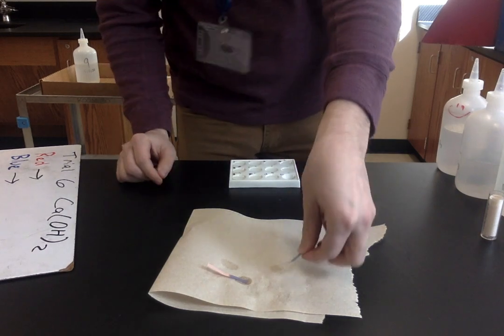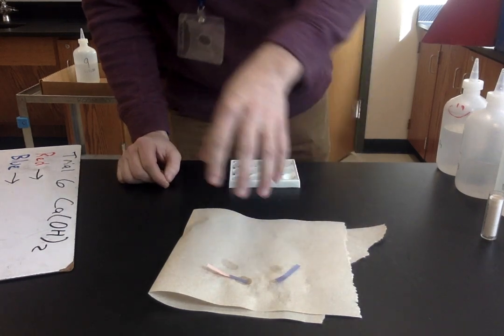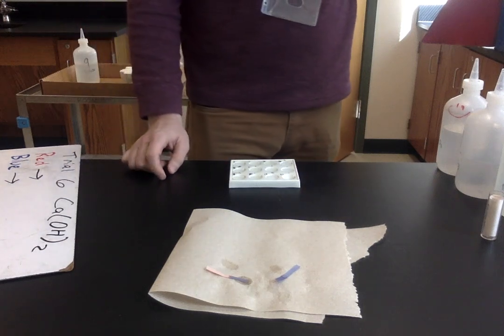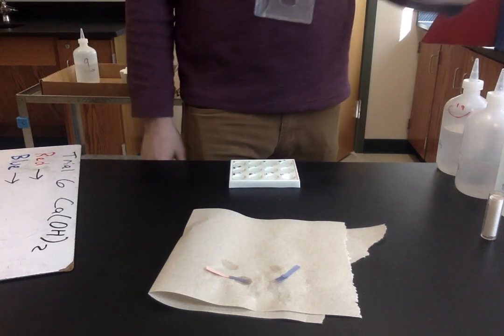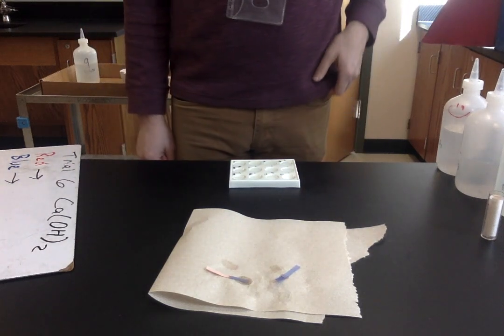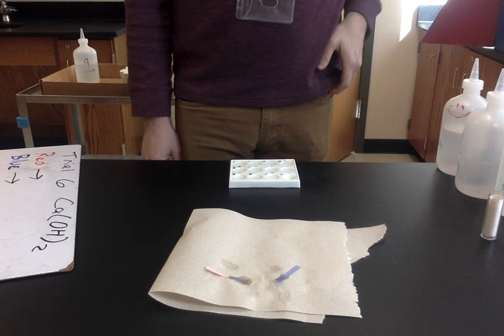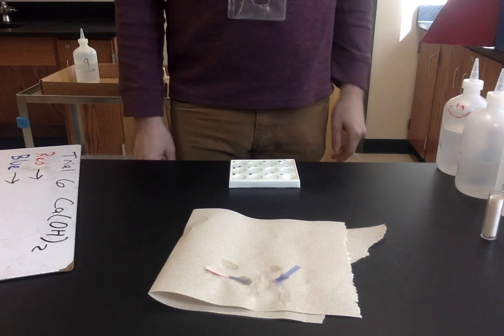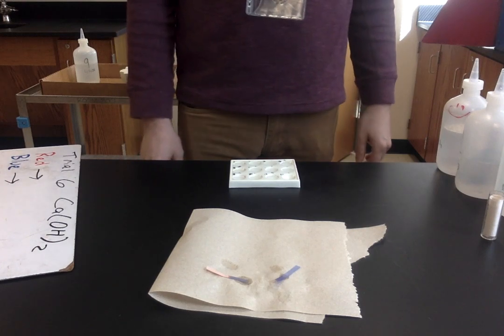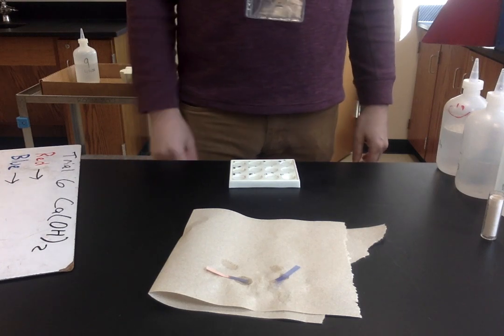Okay. Go ahead and write down which color each piece of litmus paper changed to, and then you can determine whether this is an acid, a base, or a neutral compound.